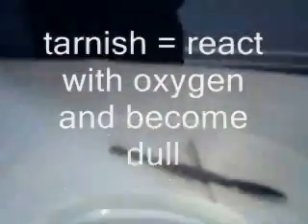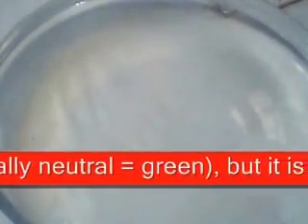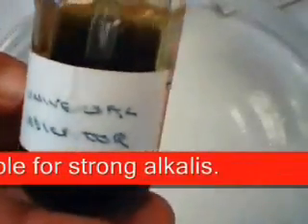Is that clipped back in correctly? Let's have a look. I'm just going to shunt that along. Now the water is clear at the moment, but I'm going to be putting some universal indicator in there. Neutral water — tap water is neutral — it should come out green.